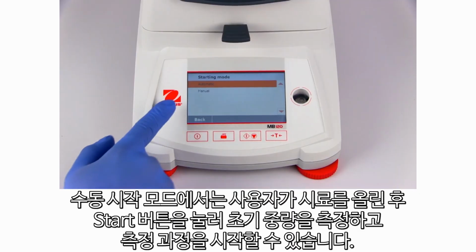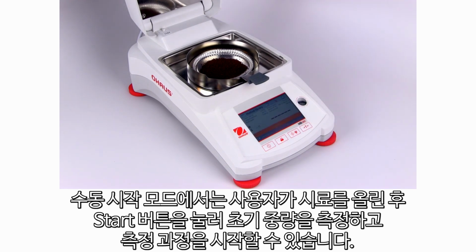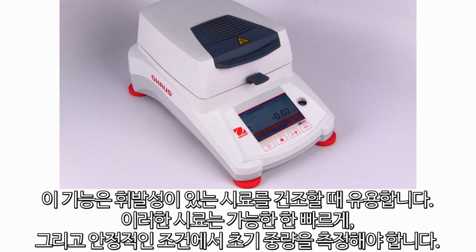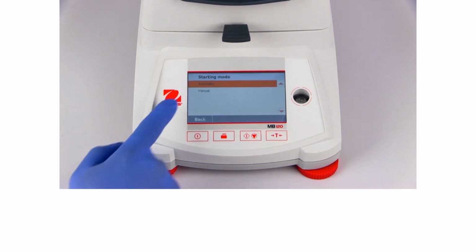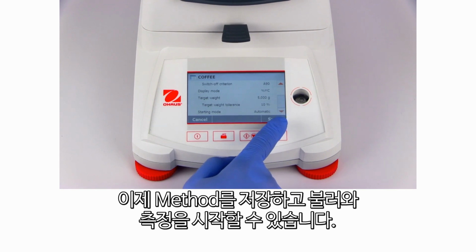Manual start mode will allow the user to place a sample and press the start button to take an initial start weight and begin the measurement process. This can be helpful when drying volatile samples, where an initial weight must be taken as soon as possible and under controlled stability conditions. The method can now be saved and loaded in order to start taking measurements.